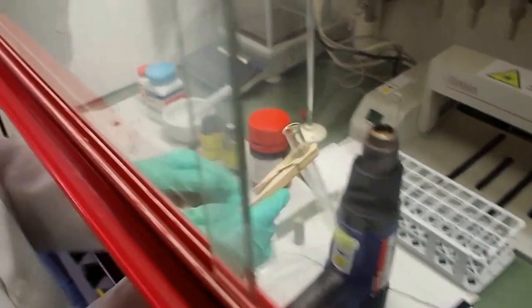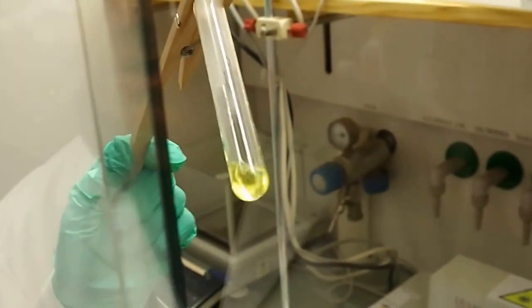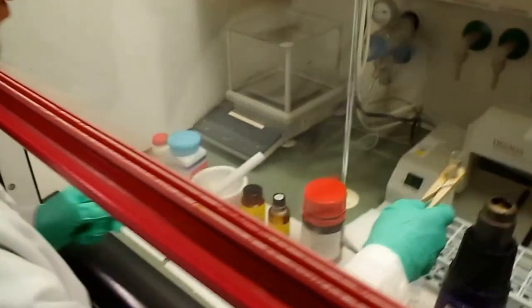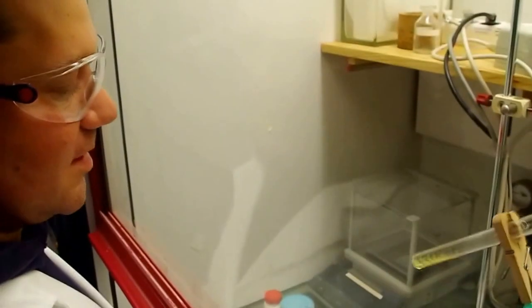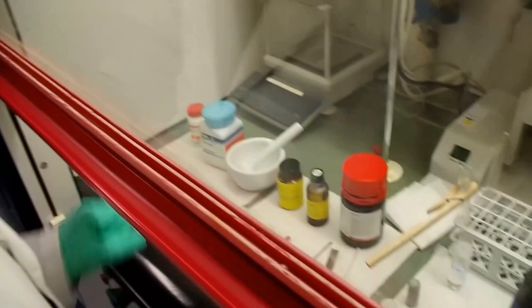Here, Michael, you see our nice cadmium sulfide nanoparticles. Nice yellow color, right? Our nanoparticle dispersion. As I told you before, we cannot taste it and see how the quality of these particles is, so we need to characterize them. Therefore, we now want to see them shine under the UV light.